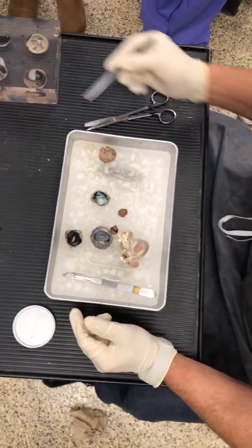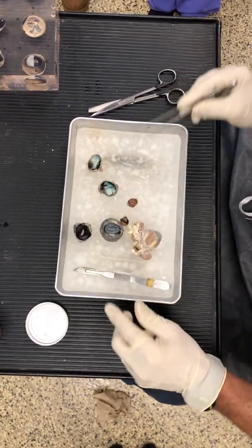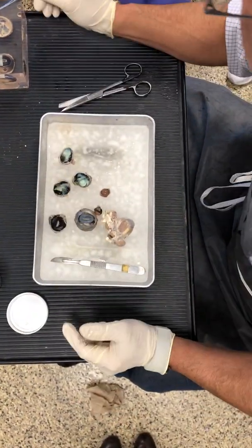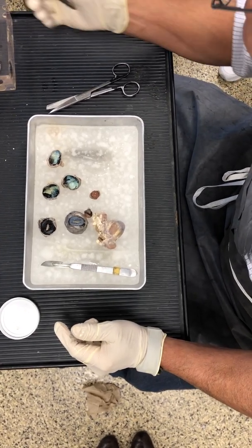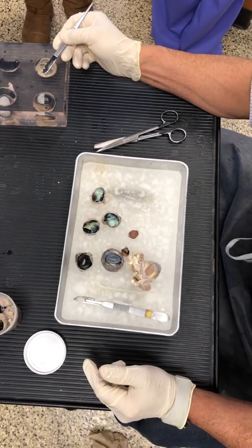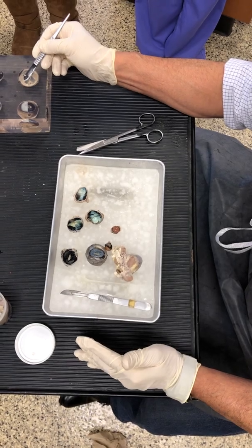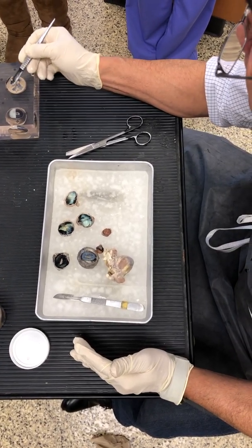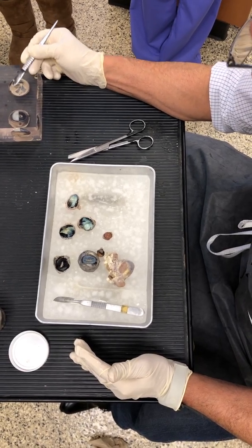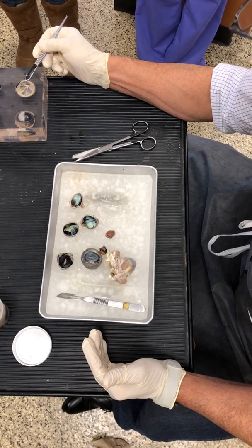Now on the inside of the optic nerve, we tilt this around like this, folks, and we peel that off. That creamish material is the retina. So macroscopically, the innermost layer of the eye is called the retina. And the retina contains my rod and my cone cells. So 6 million cone cells in my eye, 120 million rod cells in my eye.